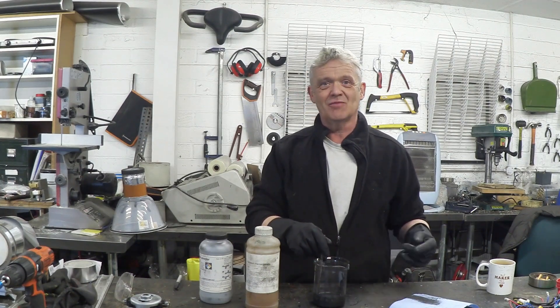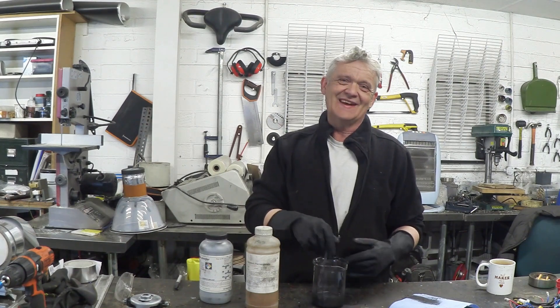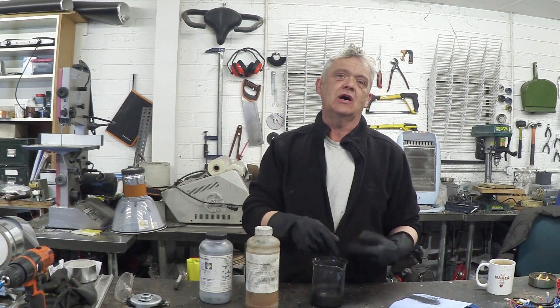Don't forget your spill kit. So we're using an acid, so you want a nice harmless alkali kicking around. I tend to use sodium bicarbonate or sodium carbonate just to chuck on any acid spills, so that I don't inadvertently lean in them later on when I'm eating my lunch or drinking my forbidden coffee. Give the whole thing a stir and let it mix up really, really nicely.